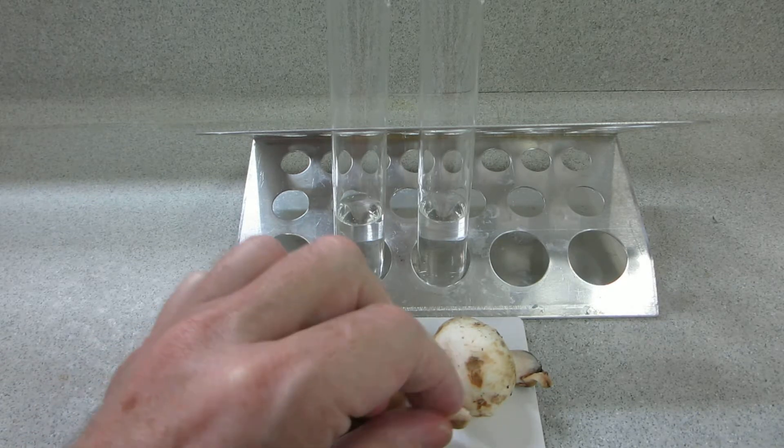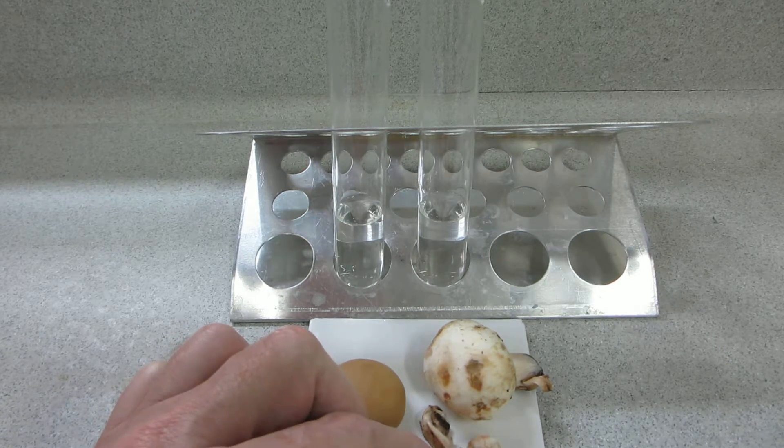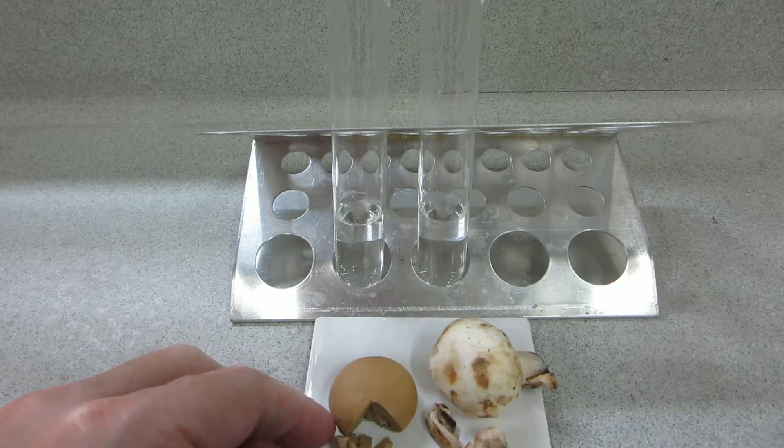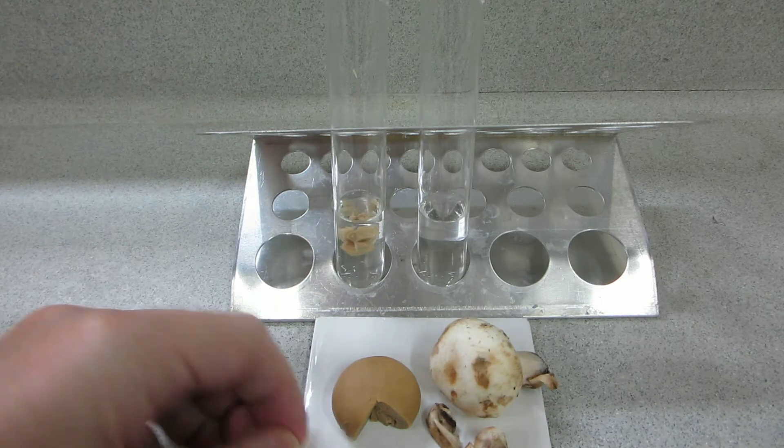If we take a similar little slice of that and cut it up again, we've got a little bit of contamination from the scalpel.